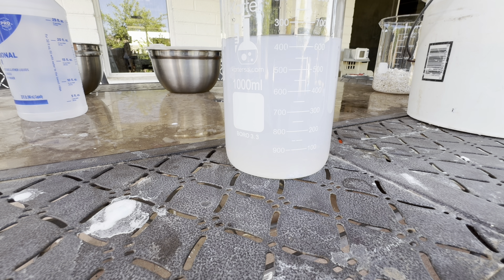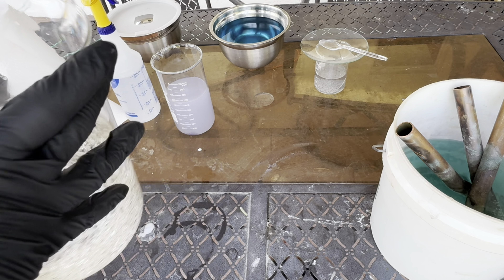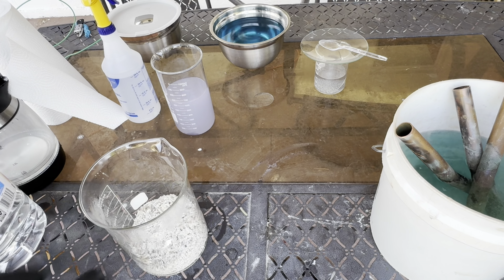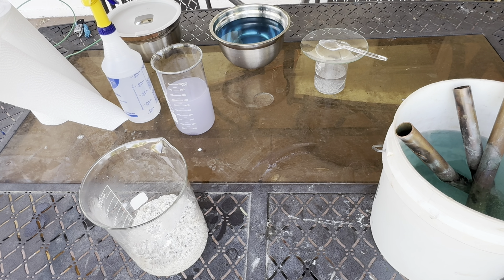So we will continue to do these boils and pour offs until we do not see this reaction occur in our samples. It's going to take a little while, so I'm going to boil some distilled water, do some pour offs, and rinse and repeat. We're going to do some rapid pour offs here. Water's boiling. Even if we spilled some silver crystal in the bucket with the cement silver, we'd get it back. Don't be scared — it's just silver. Last time I was doing this I burnt my hands so bad doing this part. This beaker gets so hot — boiling hot, literally. That's two and a quarter gallons so far.